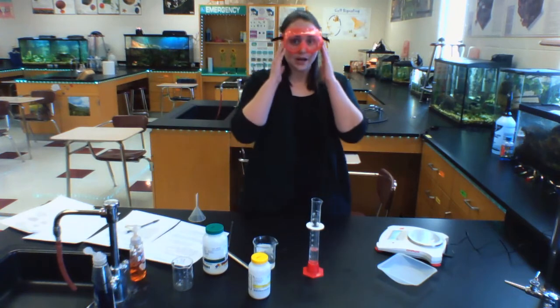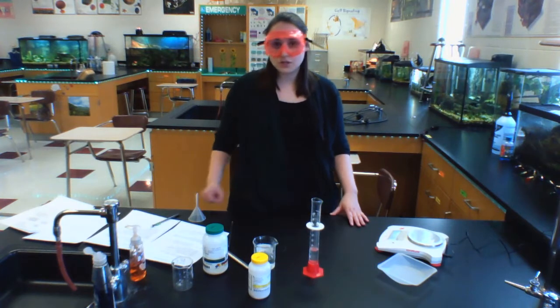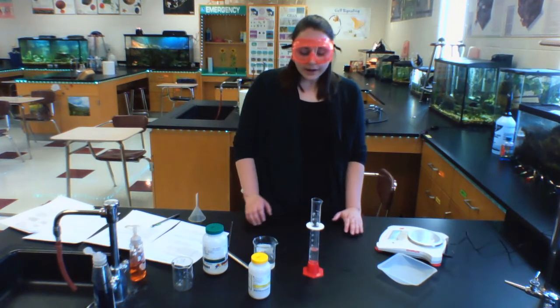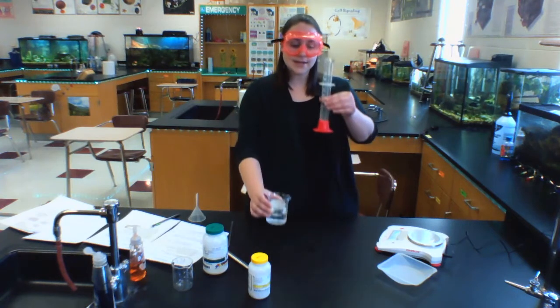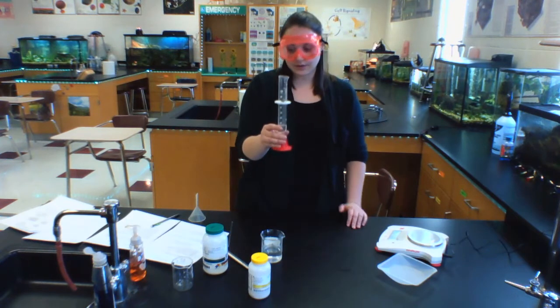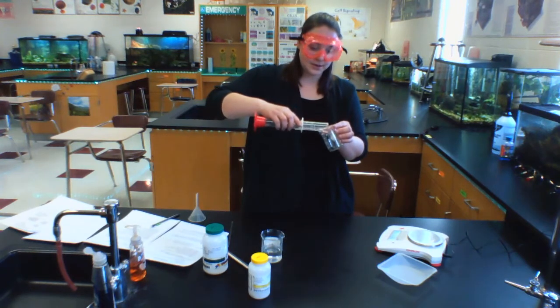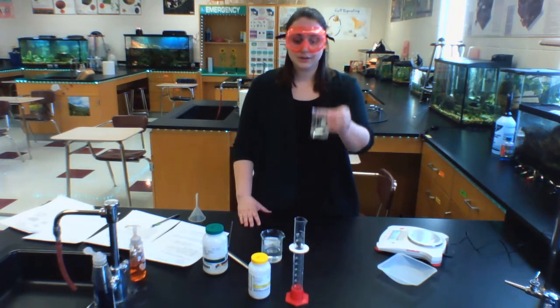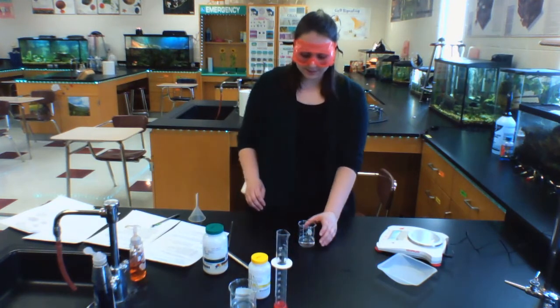So today I am wearing goggles because I am working with chemicals and I would not want something to happen to my eyes. But what I'm also going to do to be sure to be careful is to wash my hands at the end of this lab. Now, because we already made this lead nitrate solution, I went ahead and measured out 40 milliliters of that lead nitrate solution. I'm going to put my 40 milliliters of lead nitrate solution in this beaker. This beaker is where my reaction will occur. I'm going to set aside my stock solution and these materials that I'm not using anymore.